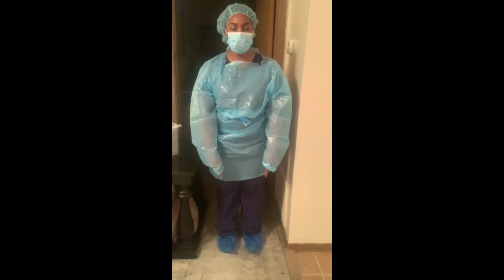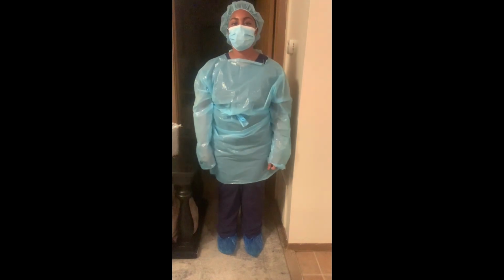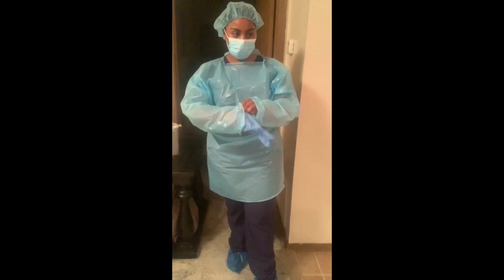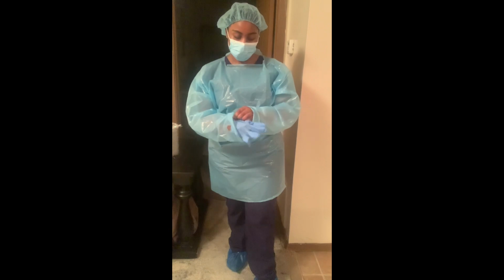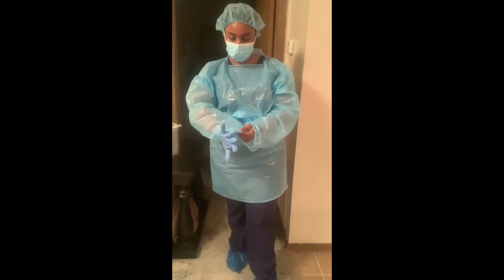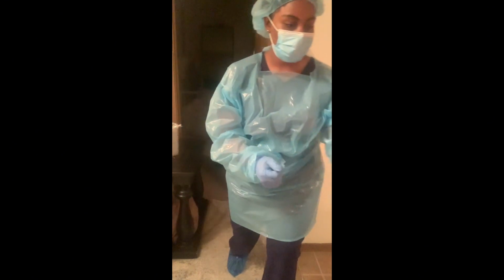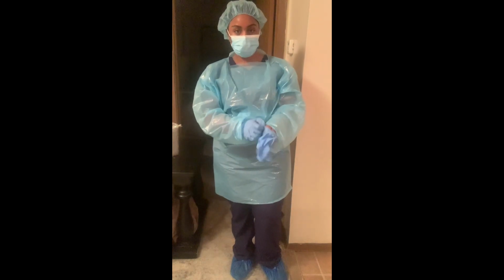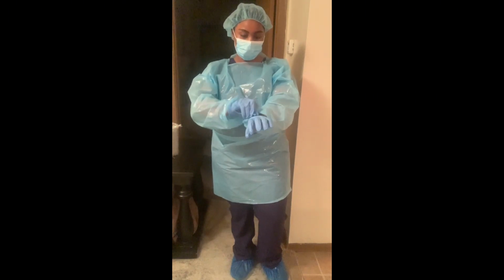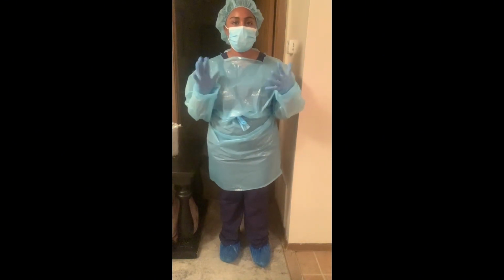Okay, so I got my shoe covers, put my face mask on, my protective little net, got my gown on, and now we're gonna do our gloves. Okay, now we are ready to go.